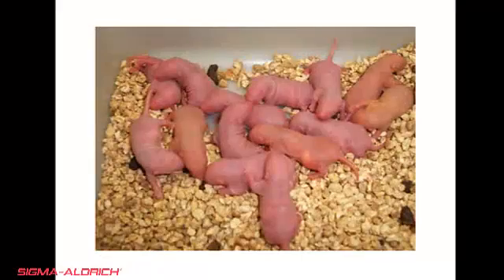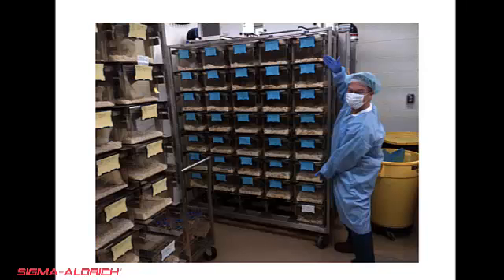After successful transfer of the injected embryos into the oviducts of the pseudopregnant recipient, close the incisions using suture and/or wound clips. Place the animal in a solitary cage that has been warmed using a heat pad, and allow the animal to recover. Our mice are generally multiple housed up to 5 per cage until about 4 days before the due date. At this point, they are broken into cages containing 1 to 2 females. We target 4 recipients per session of injection. Please follow your institution's established guidelines regarding proper animal husbandry.